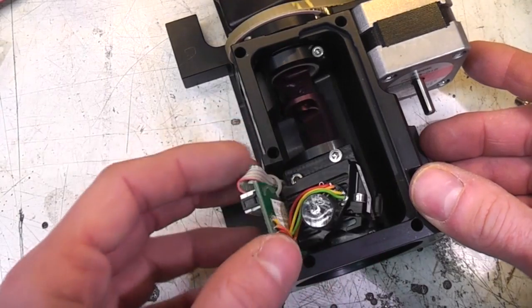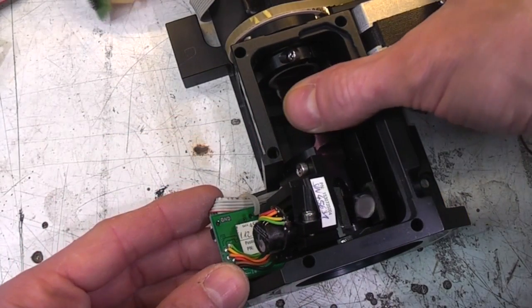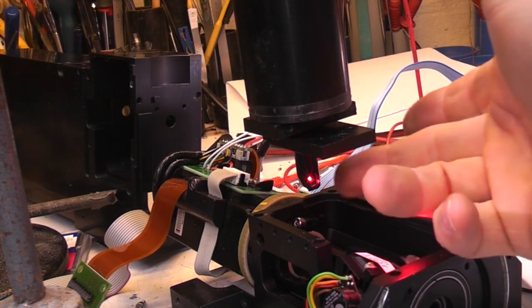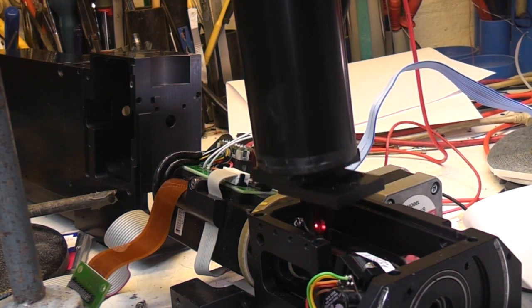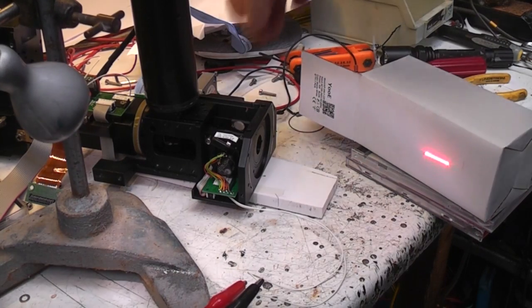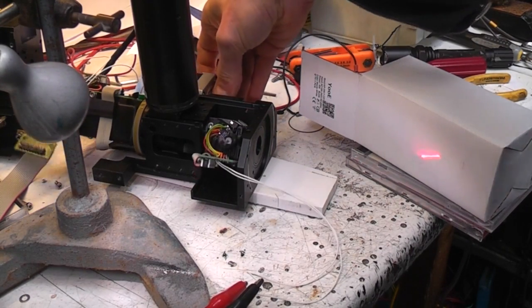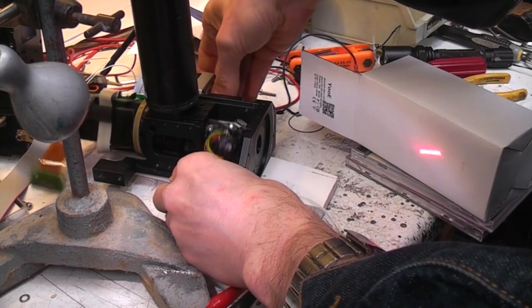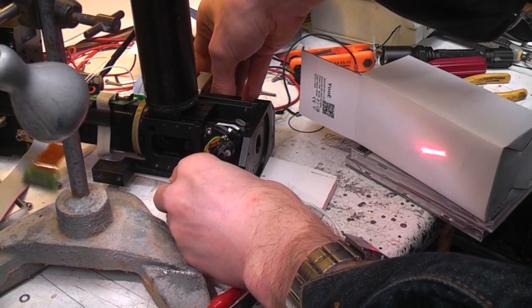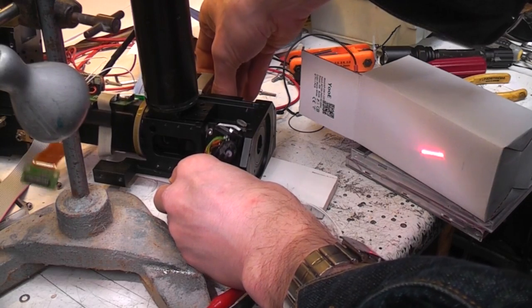In fact, what I should probably do is just whack a laser into this and manually operate this. I should be able to get a clear idea of how it scans. Let's try that. I took the red helium neon laser up along with this mirror to actually get it down into the right place. So I've lined this up and I've hooked the coils of the galvos to the signal generator just on the sine wave. The Y and the X, and together we have the inevitable Lissajous figure. If I just rotate the stepper, you can see it just does, this isn't completely lined up for rotation, but so it just rotates the scan around. The fact it's not rotating around the centre is probably just the way I've lined it up.